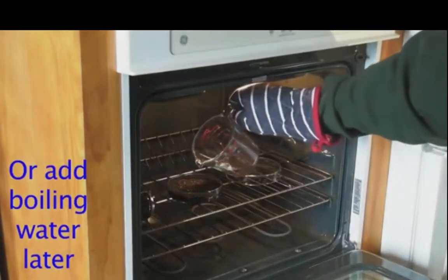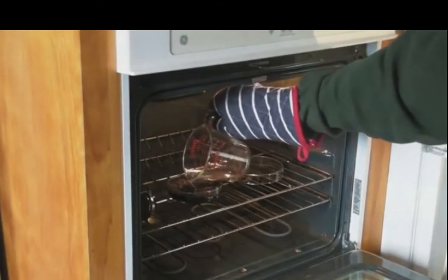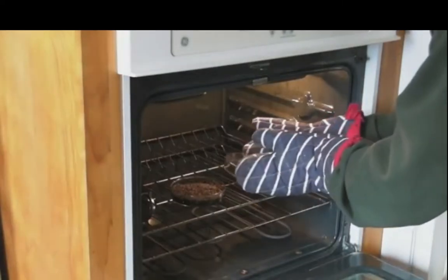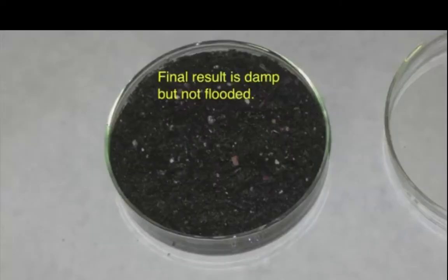Alternatively, you can put the Petri dish into the oven with dry soil, cook for 30 to 40 minutes, and then add boiling water and cover. Either way, you want to put the cover on while the oven is fully heated, cook for an additional 5 minutes, turn the oven off, and let the Petri dishes cool in the oven. By the way, don't worry if it dries out. You can always add more water and cook a little longer.